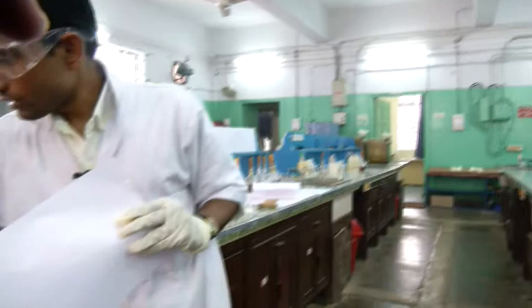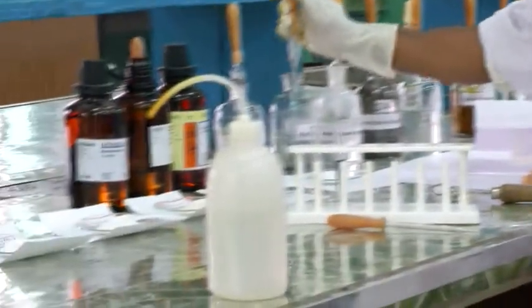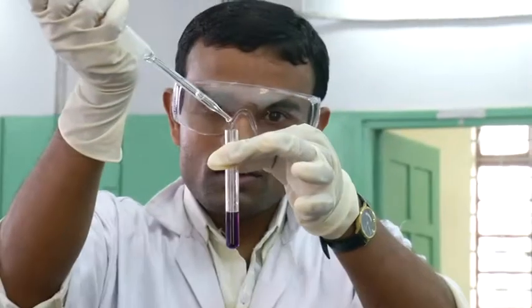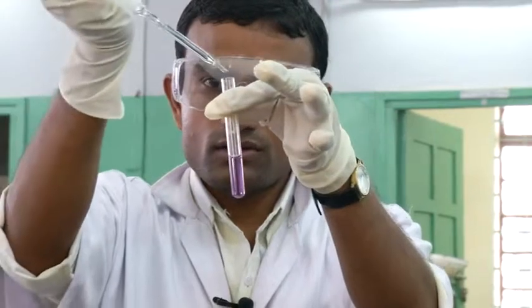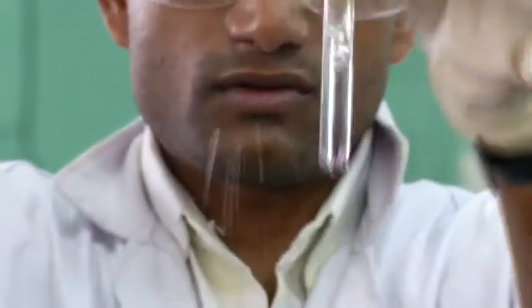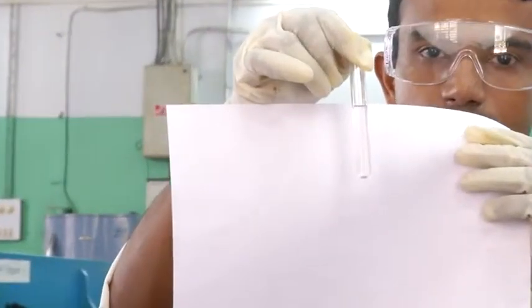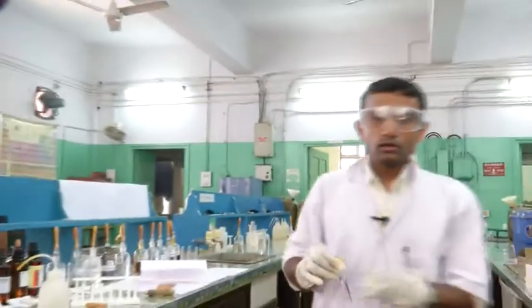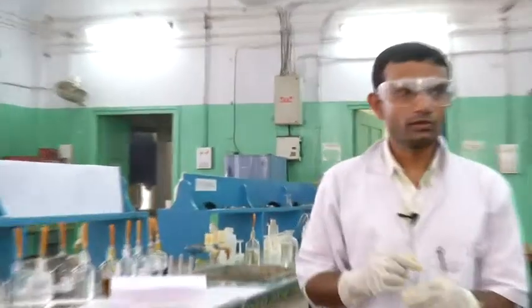To discharge the color I have to add dilute HCl. We can see the color — it is a nice violet color. Now I will add dilute hydrochloric acid to discharge it, and you can see the color is gone. This is a nice test for salicylic acid — there is no color basically after adding acid. Thank you, we have done this for today and we will come back with more exciting experiments in future.